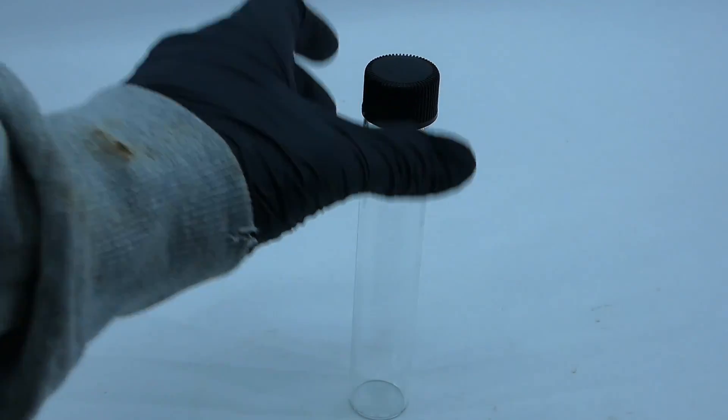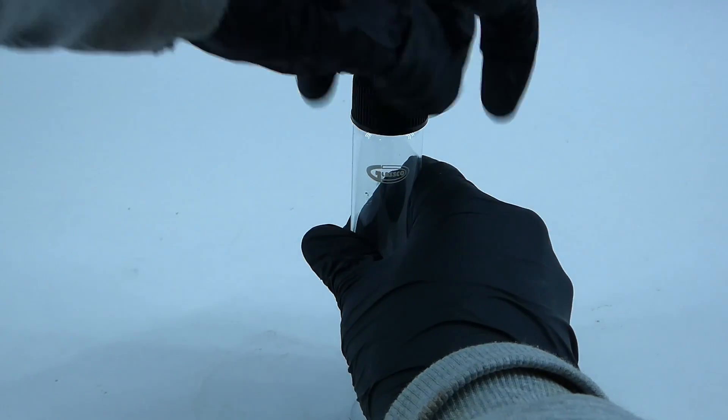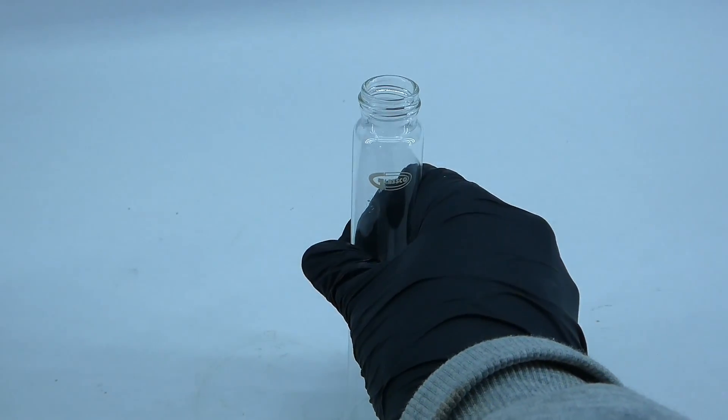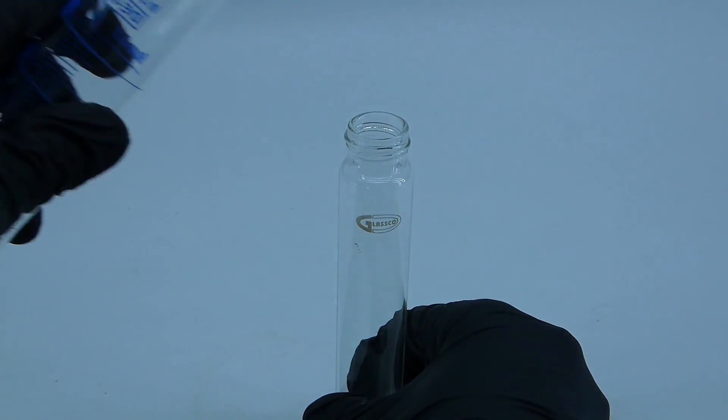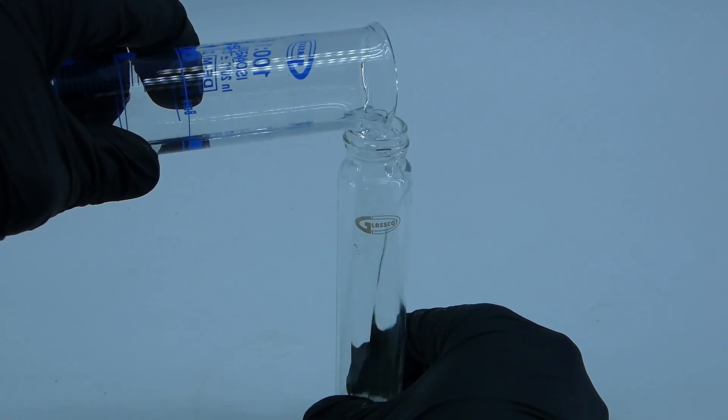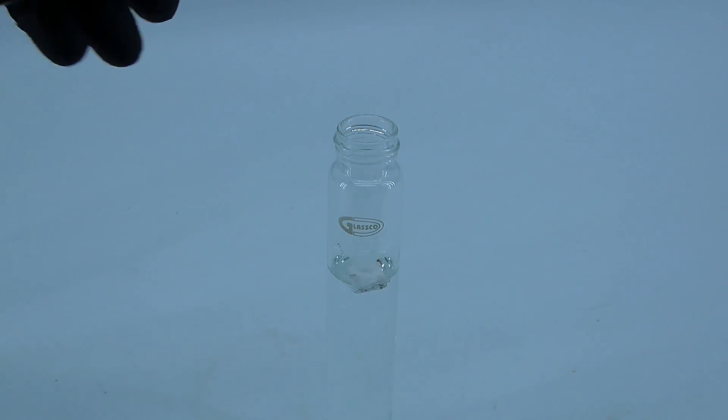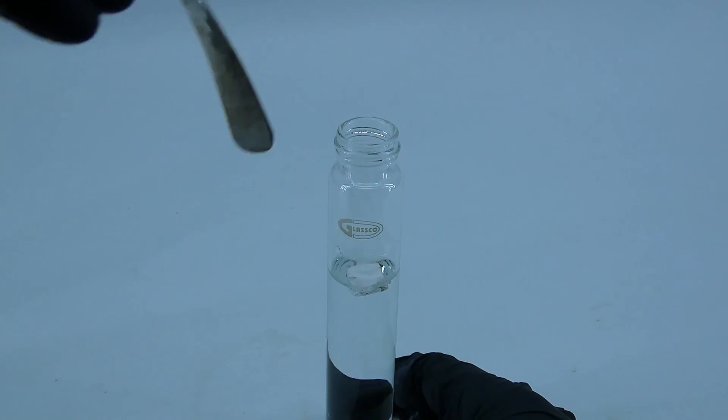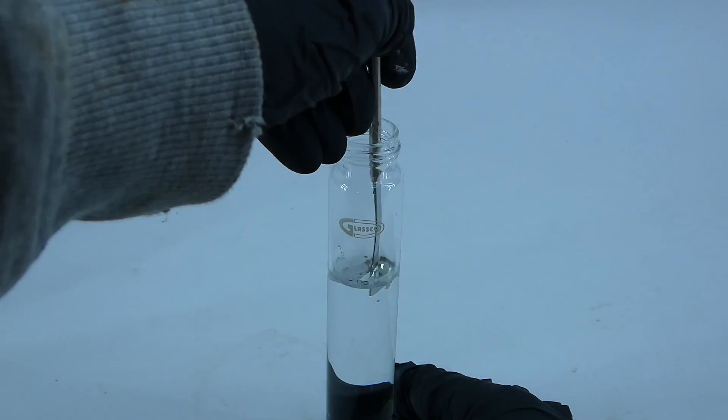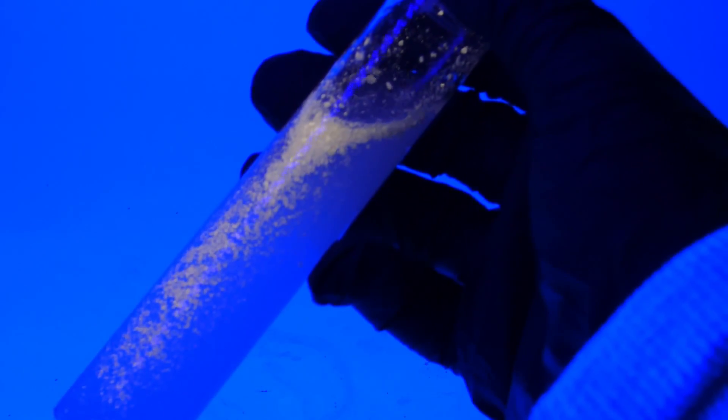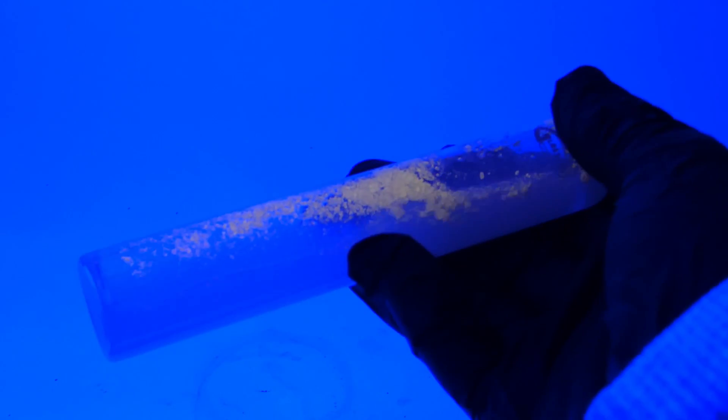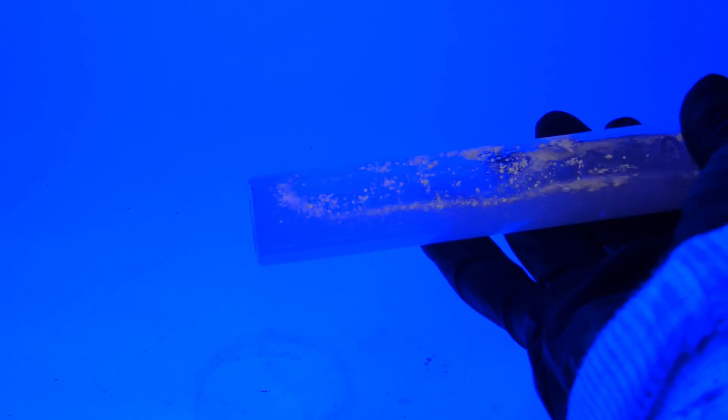After letting my frustration out on an innocent ampoule, I really wanted to make a glowing vial, but when I got around to making it, the complex was already dry, and in that form, it really didn't want to mix with the water and gave a pretty bad result. To improve it, I have to make some more of the complex and use it when it is still wet, but now that my current supply is dry, I wanted to wait and do some experiments with it.